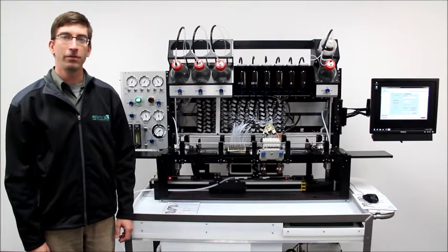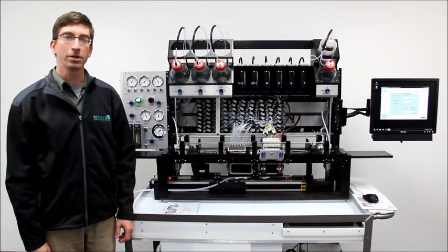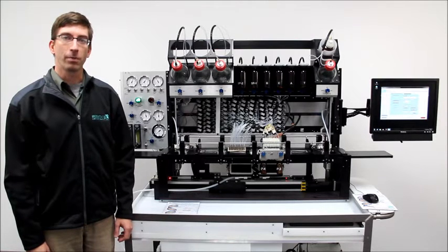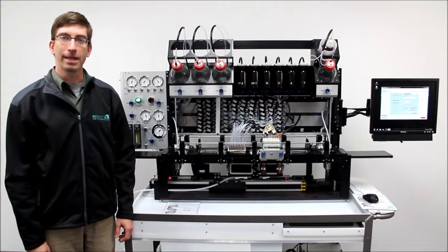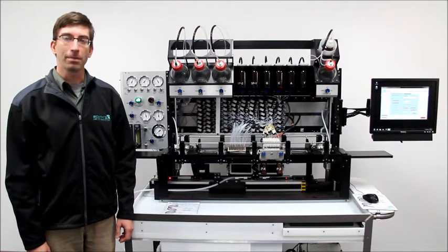This video will give a brief introduction to the instrument and software, its capabilities, and its operation.